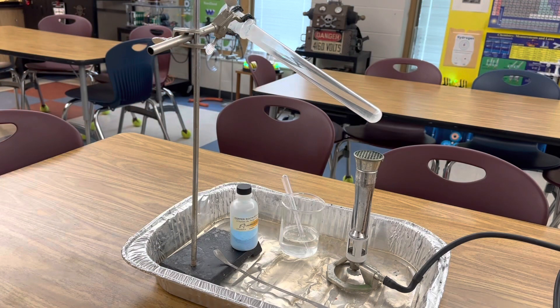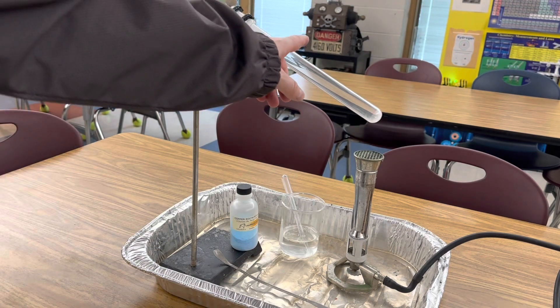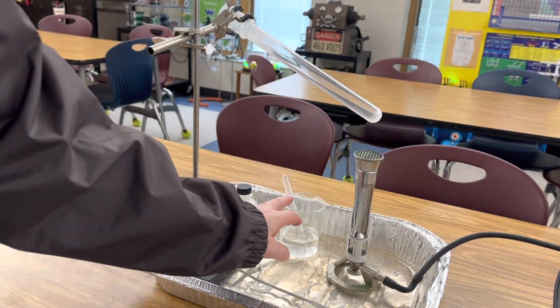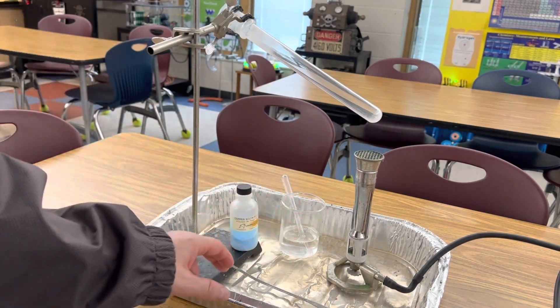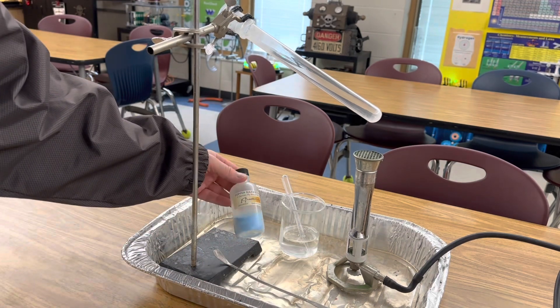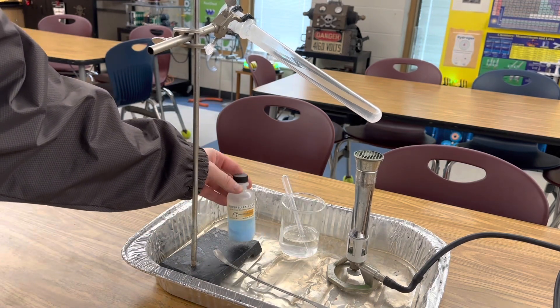For this investigation, I'm using my boiling tube, Bunsen burner, some water and a dropper, my spatula, and copper sulfate.